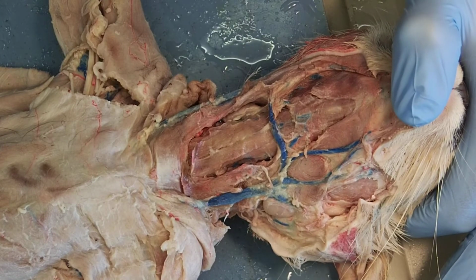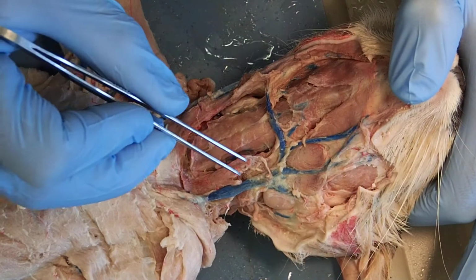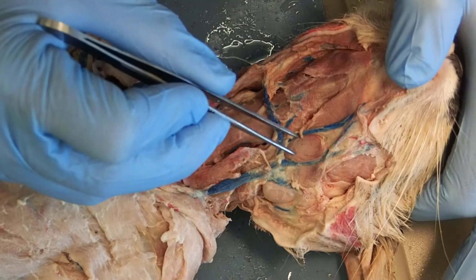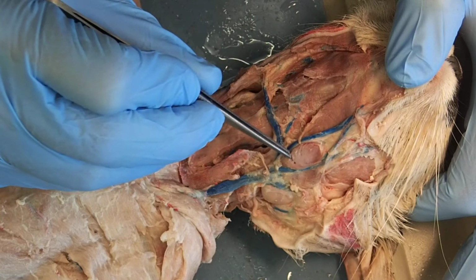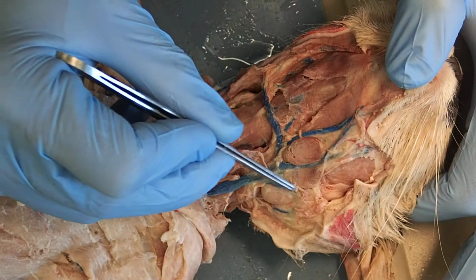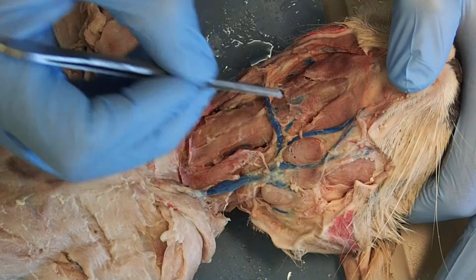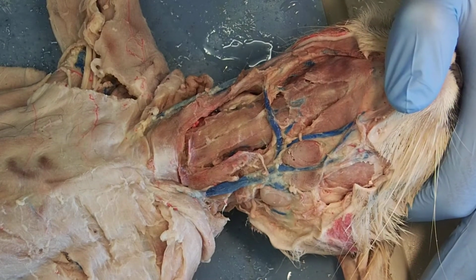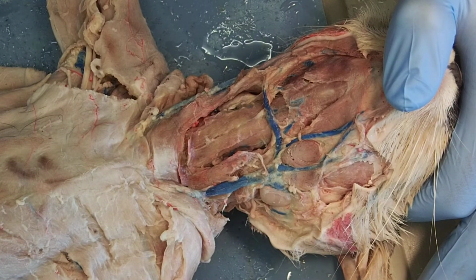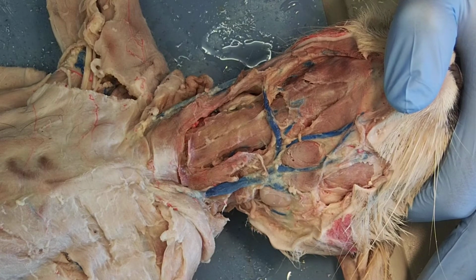You don't have to know the glands. We're not going to cover those. One of the glands that you can see is the mandibular gland, and the mandibular gland is right here. It's this big brownish structure, glandular-like tissue. If you were pinching it, you could see it falls apart very easily. Glandular tissue, unlike your muscle, is really just like this loose granular-like stuff, almost like an organ. And as you pick at it, it just starts falling apart in your tweezers.